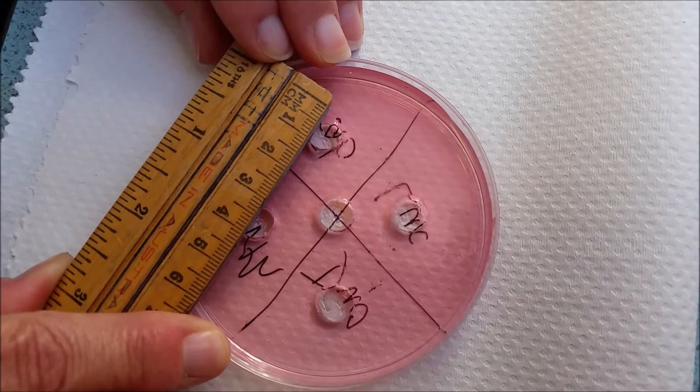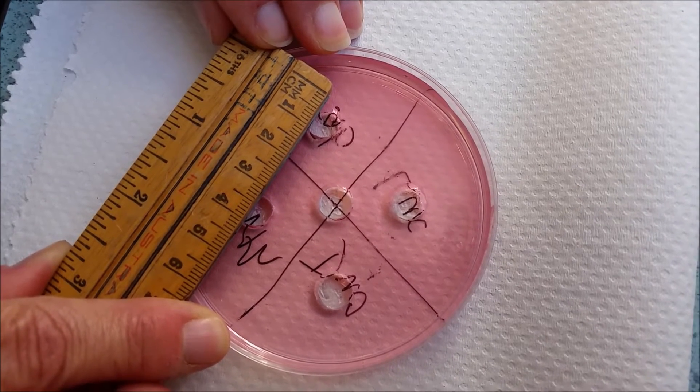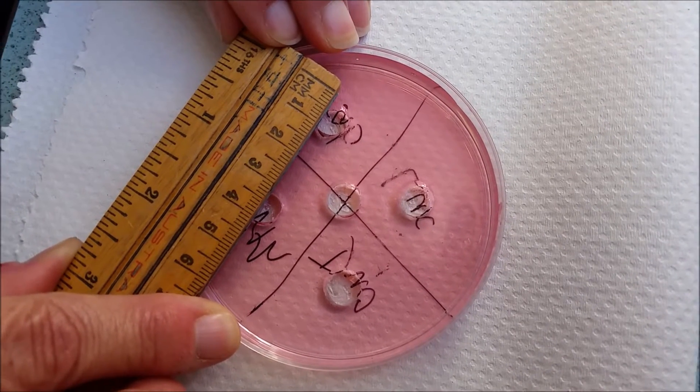However you measure it, whether you position the line, as long as you keep it consistent from one well to the next and then before and after your experiment.